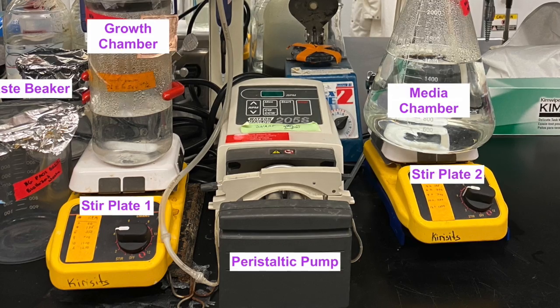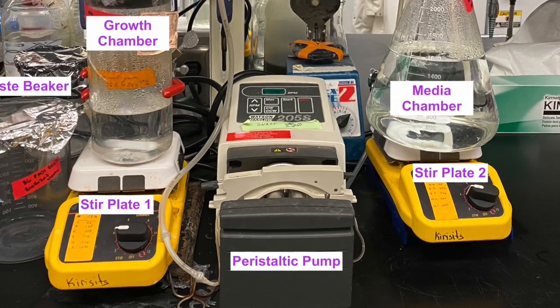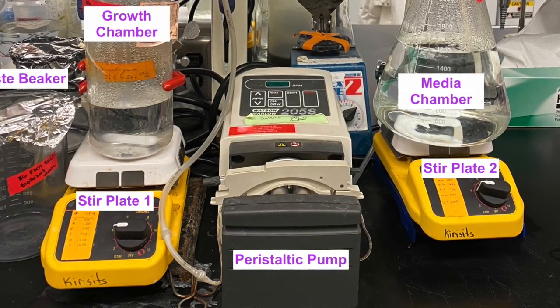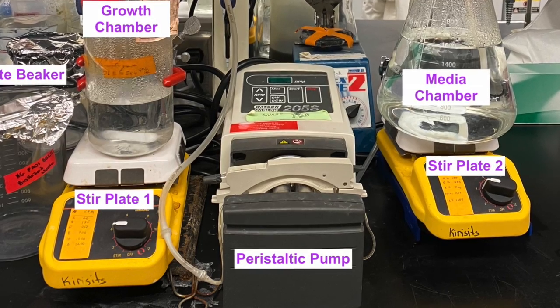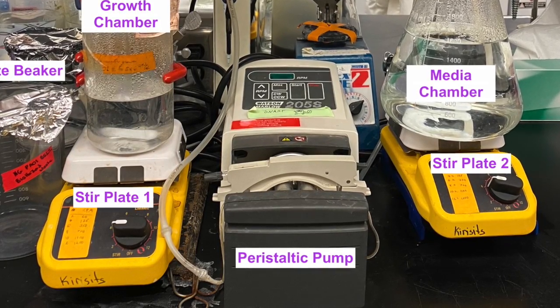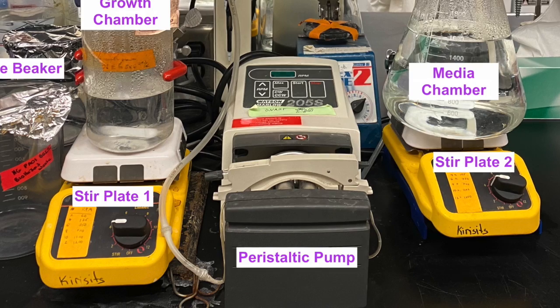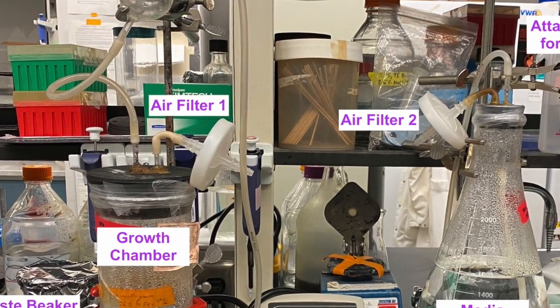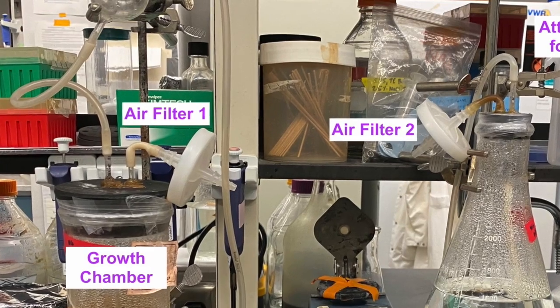A peristaltic pump is used to initiate flow from the media chamber into the growth chamber. We can control the direction, whether it's counterclockwise or clockwise flow, and we can control the speed of the flow with this pump. Air filters are connected to the tops of both the growth chamber and the media chamber.